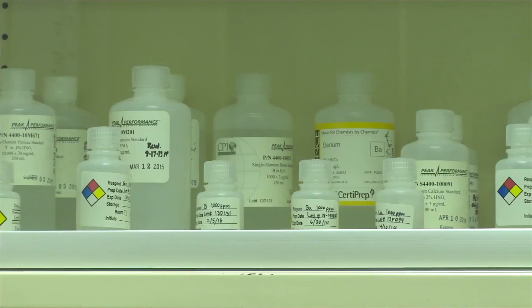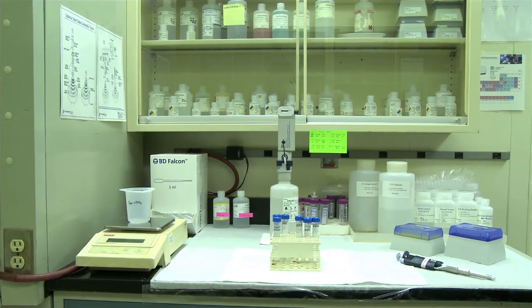We also run IC, which is ion chromatography. We use a positively charged column to separate out negatively charged molecules: sulfate and chloride in one method, and then organic acids in a second method, where we are looking for acetate, butyrate, formate, and propionate. The column is flushed with a basic solution as the ions separate by charge and molecular size, and then they are flushed out by the basic eluent. And again, we see them on the computer as a signal.